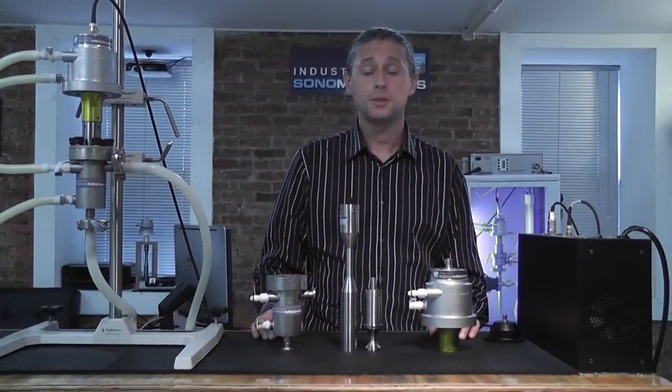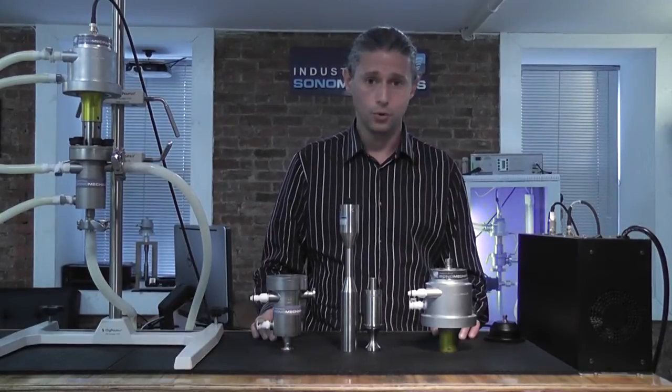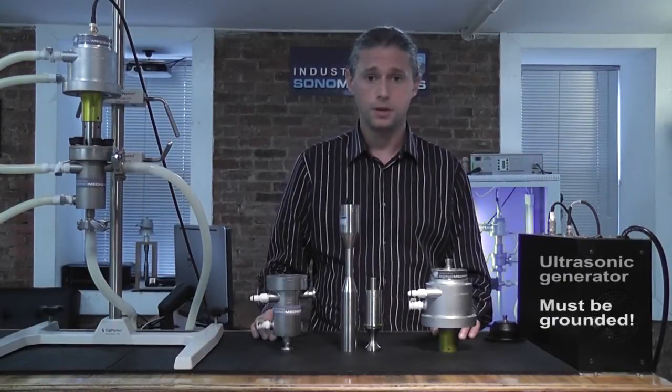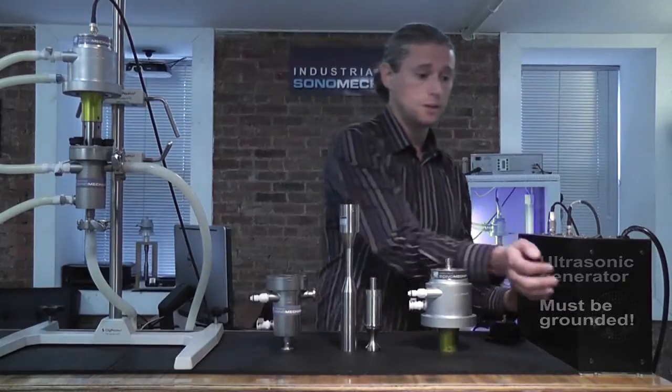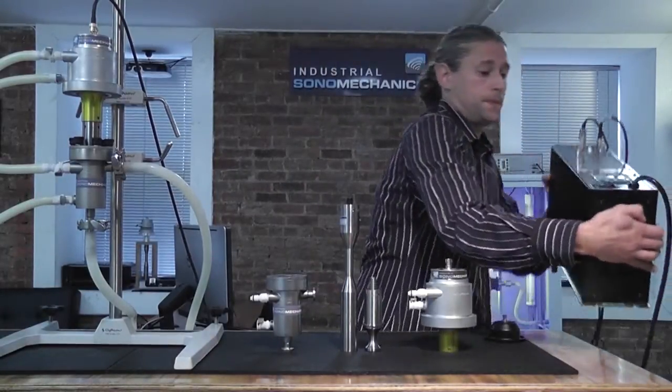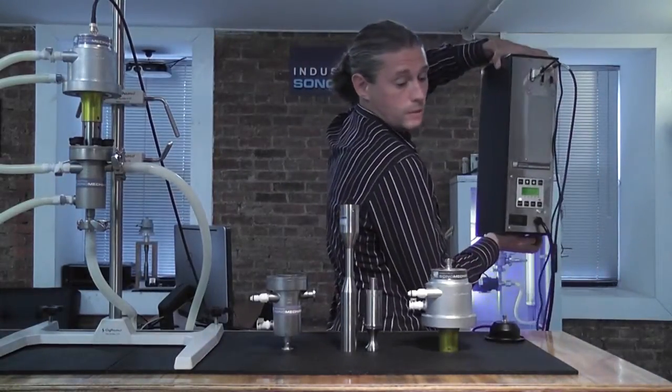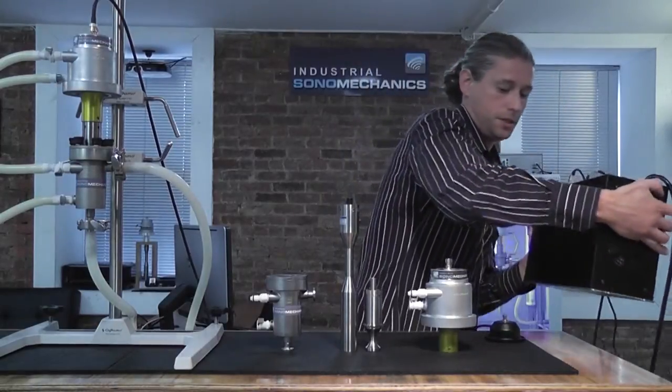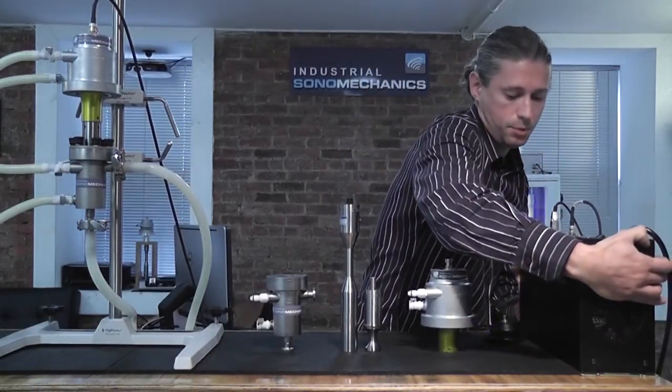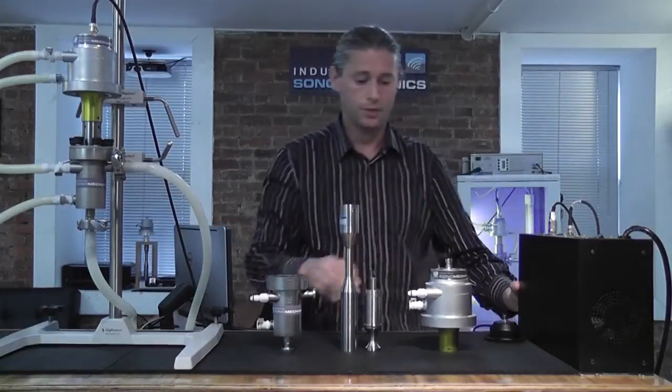The system consists of four major components. Component number one is the 1200 watt ultrasonic generator. Commonly, it hangs on the wall or it could be positioned in a rack. For the purposes of this video, we'll just have it down here.